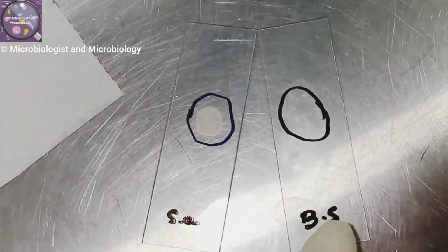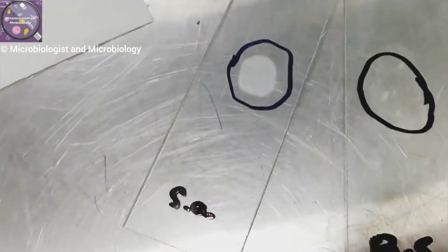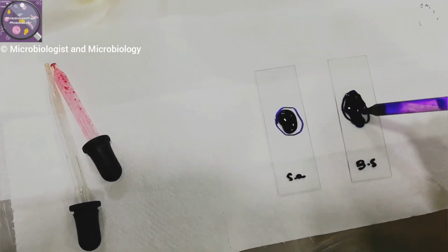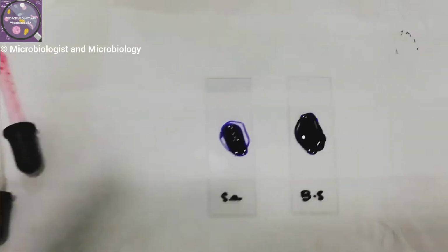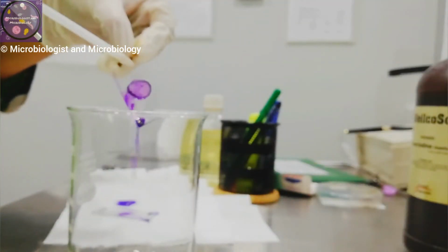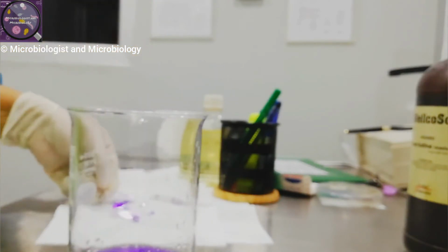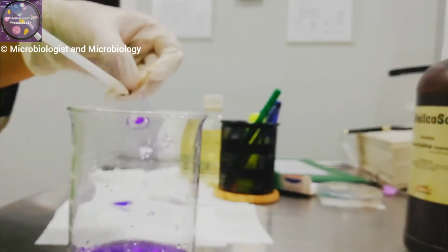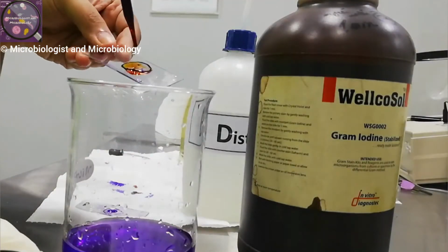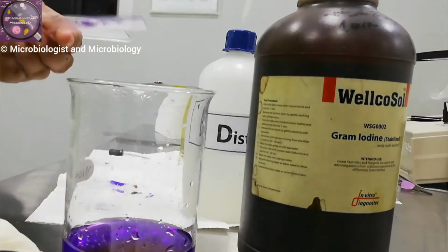One is of S. aureus and one is of Bacillus subtilis. Let's start our staining procedure. Add a drop of crystal violet on both slides to cover the smear for 1 minute. After waiting for 1 minute, wash the slides with water for a few seconds. Now our next step is Gram's iodine. Treat with a few drops of Gram's iodine for 1 minute and again wash with water.